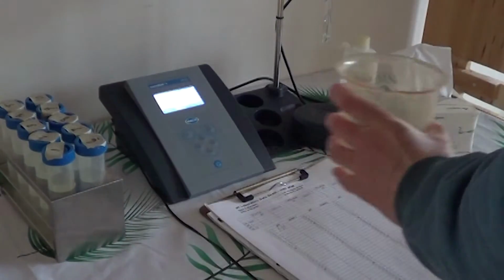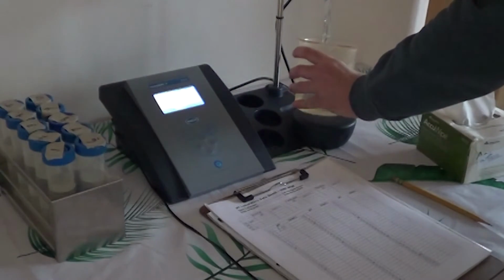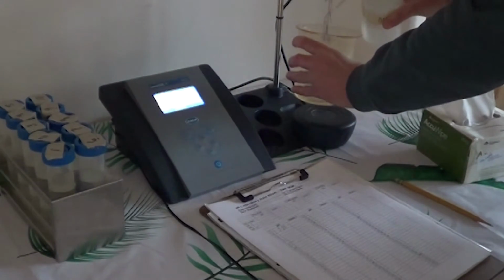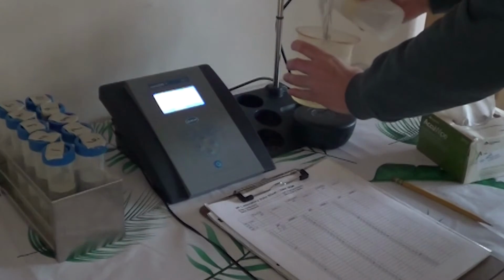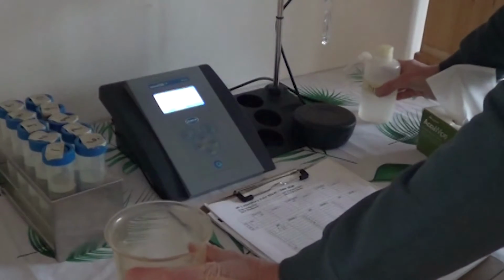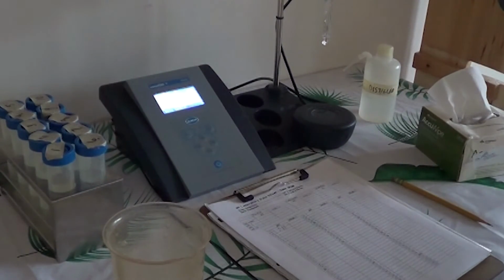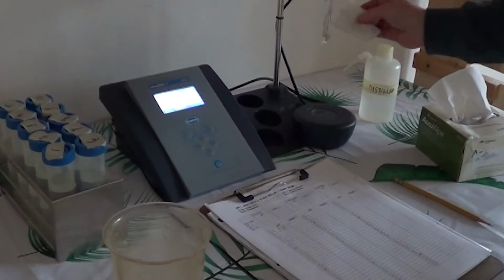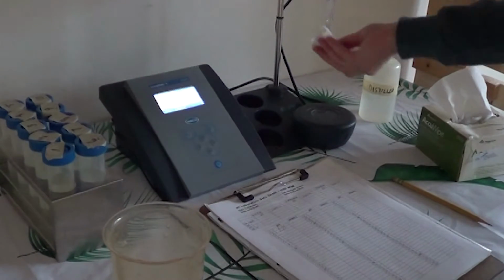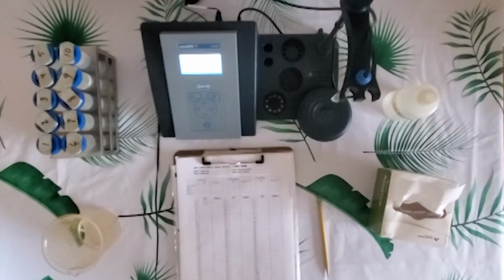Okay, so we had the sleeve on there, so we're going to start by rinsing our probe tip. We have our waste beaker and the DI water. We're going to make sure we hit that probe tip. We're going to take our AccuWipe and just blot this probe tip dry, or at least get some of that excess water off of there.